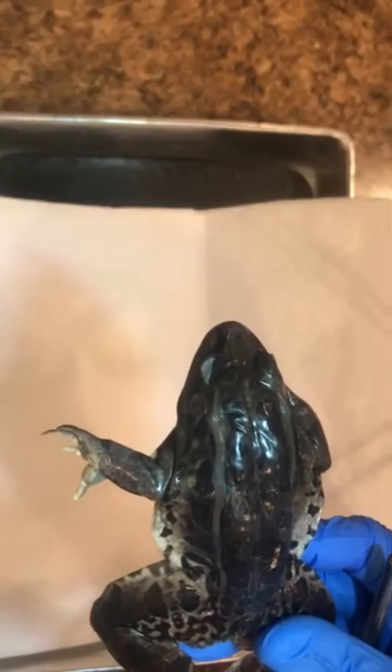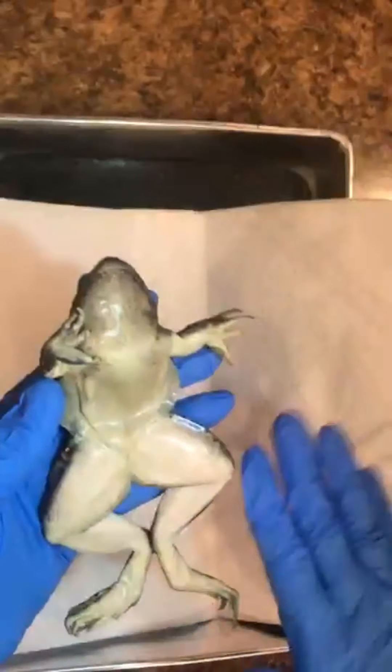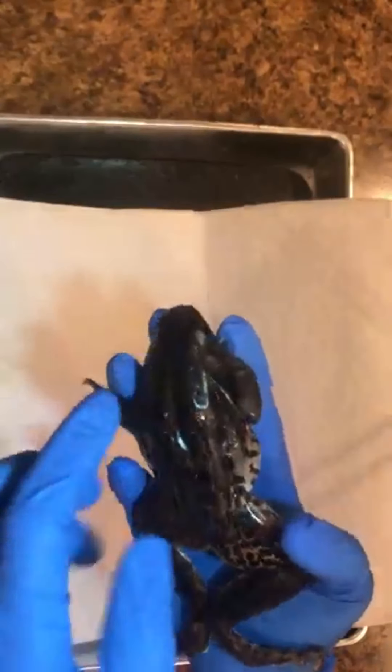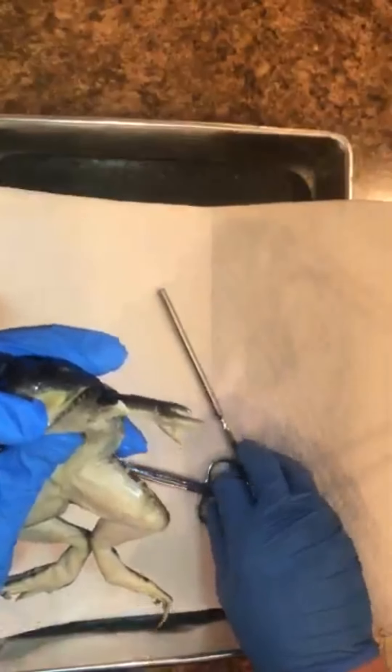Now we're going to start cutting to look at the mouth. The ventral part of the frog is much lighter in color — you never see a frog lying belly-up, which would be bad for camouflage. I'm using my scissors, scalpel, and probe because the mouth is basically stuck here. You can already start to see the tongue, but I need to make some cuts to open it up properly.